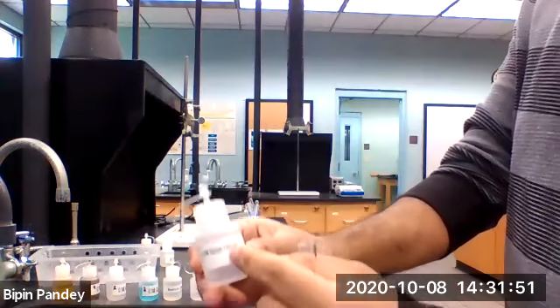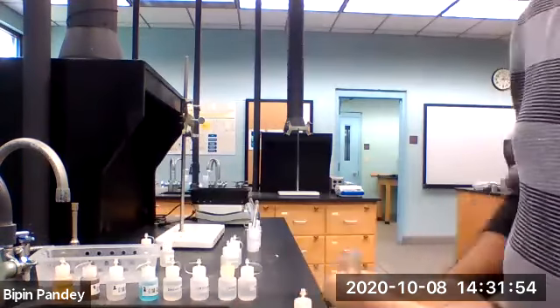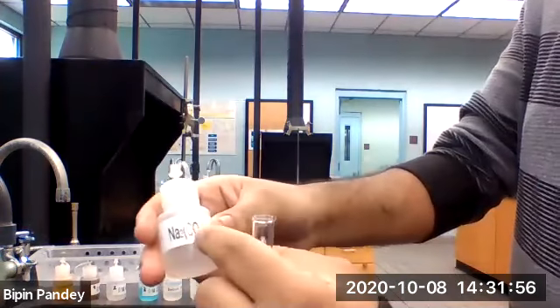Again, barium chloride, sodium carbonate.